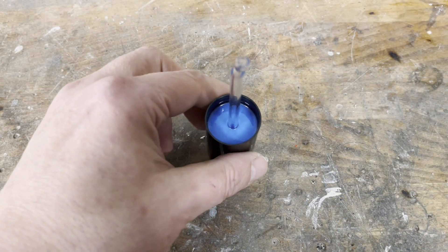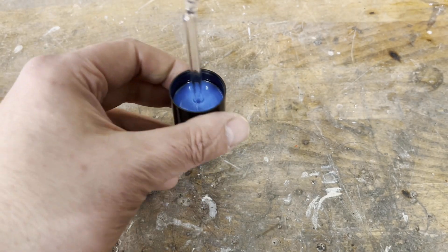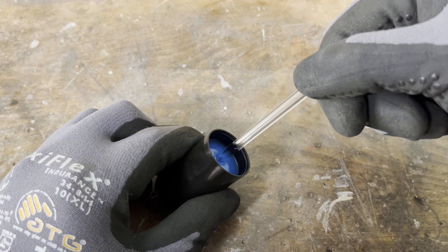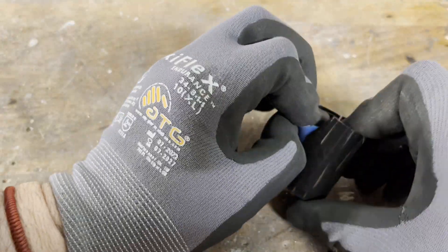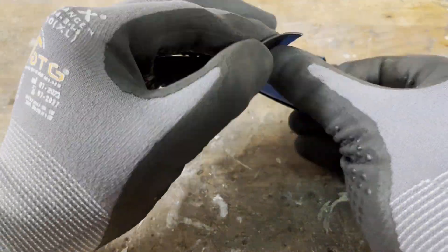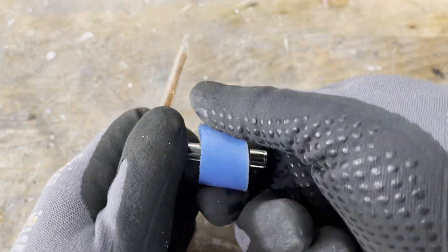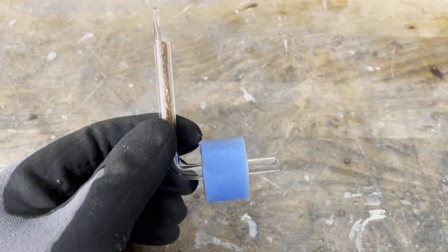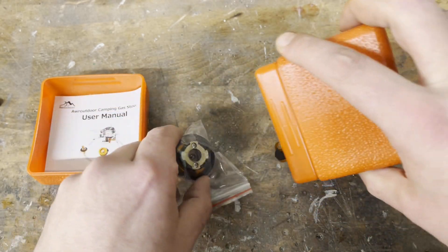I cast a silicone stopper from two component silicone to secure the flame tube using a pipe clamp. I then built a low profile lab burner from a camping gas stove.